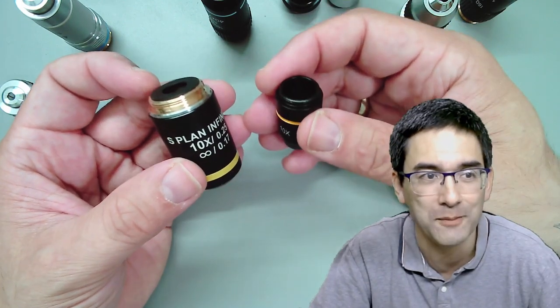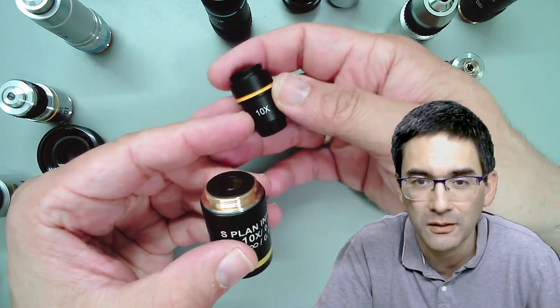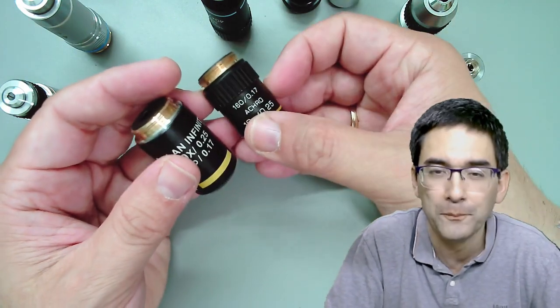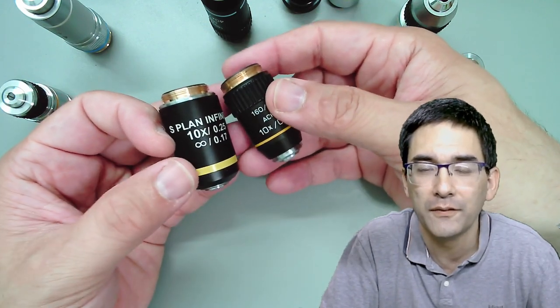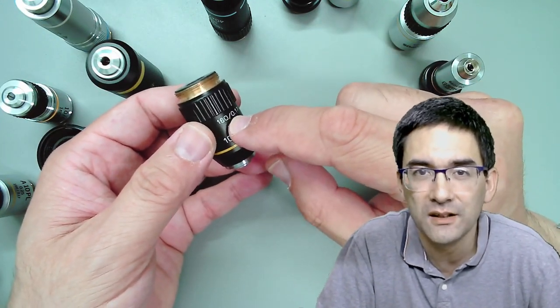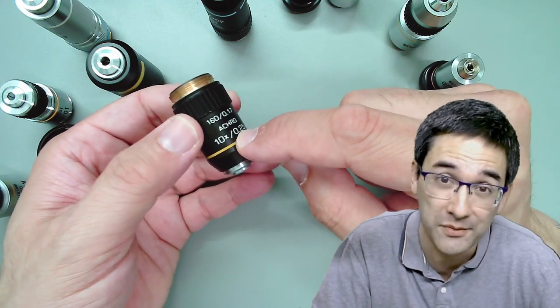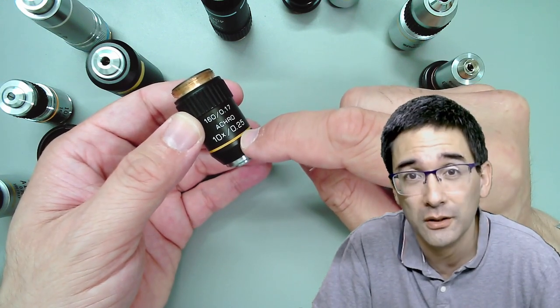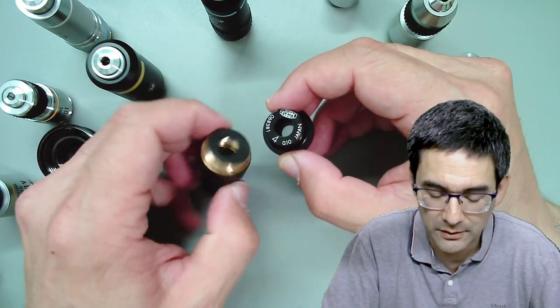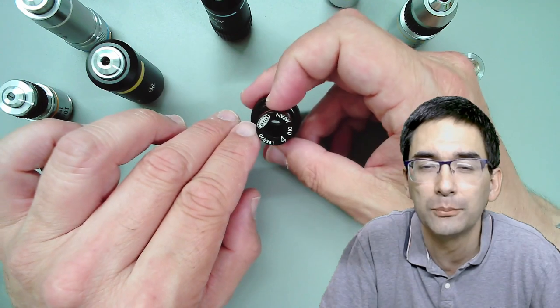Let's talk about the numbers printed on the objective. This children's microscope objective doesn't even have other numbers, but on a typical objective you'll find: 160, then 0.17, then of course the magnification - 10x, 4x, 40x - and then a decimal value which goes up to approximately 1.25. For example, here there's a 4 printed and the decimal value is 0.10.